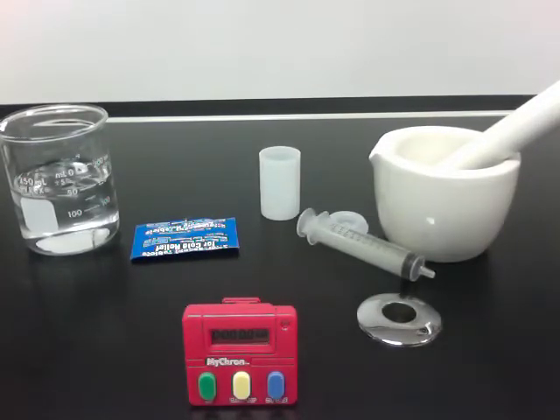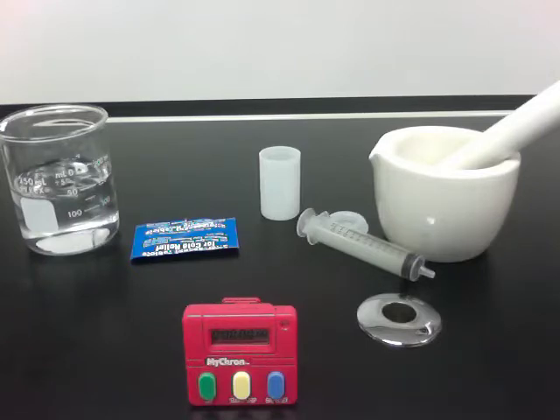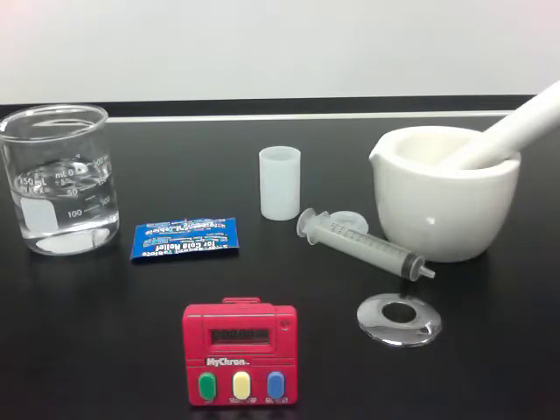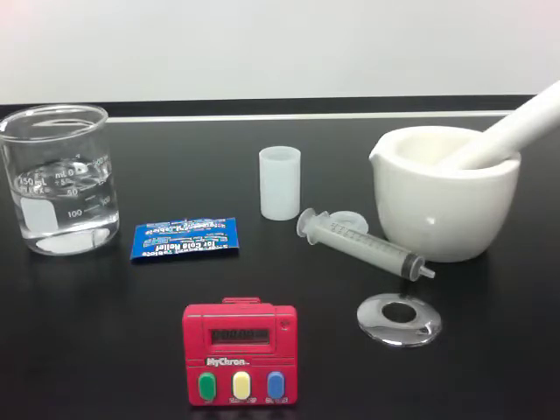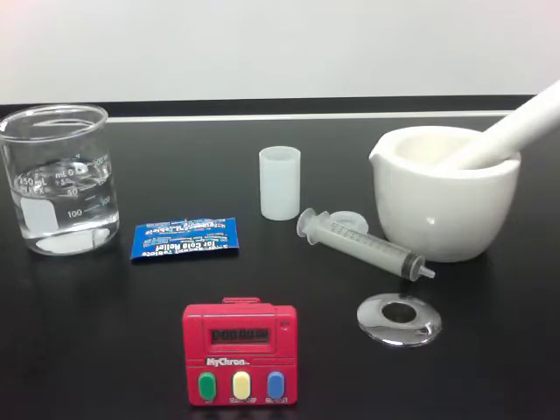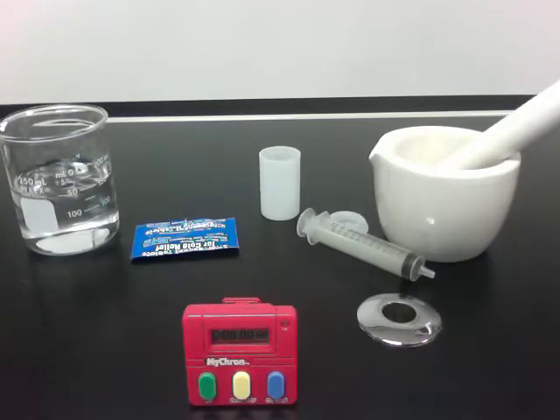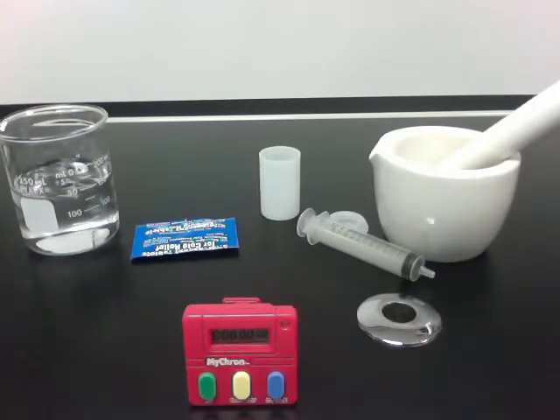In this lab, we're looking at the effect of increased surface area on reaction speed.